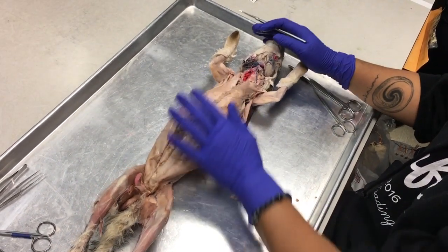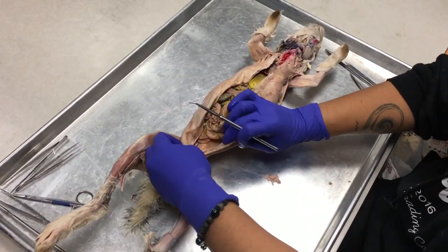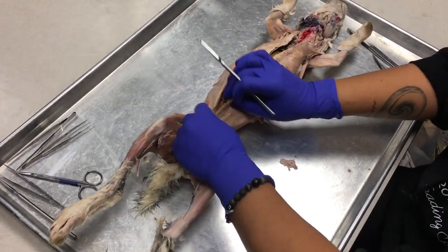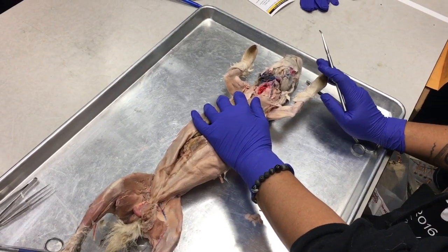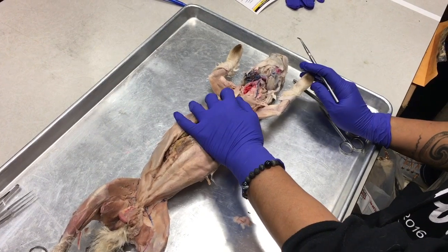So, all right, we're gonna start with the ventral side of the cat, and oh, sorry, little guy. Bunny, sorry. All his little stuff's coming out. All right. I have a male rabbit, by the way. If anybody has a female in this lab, please tell me. Okay, good, because we didn't have any in the other lab.